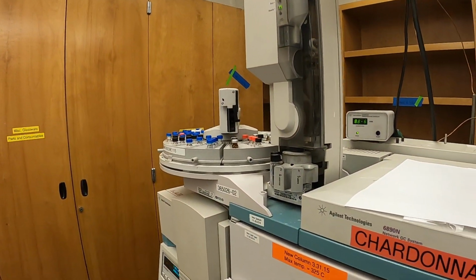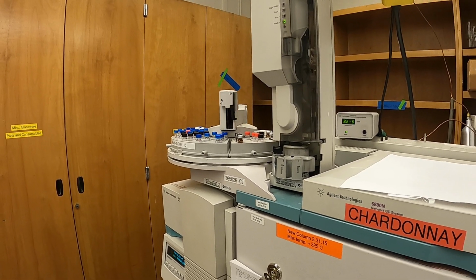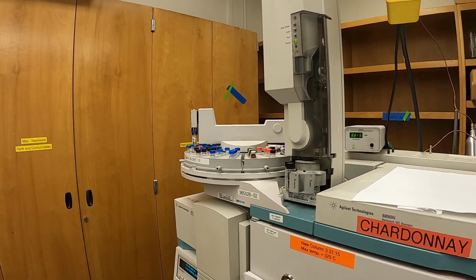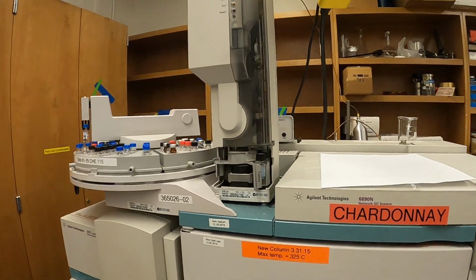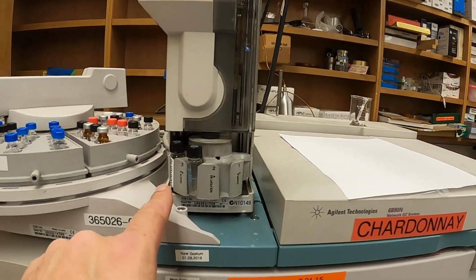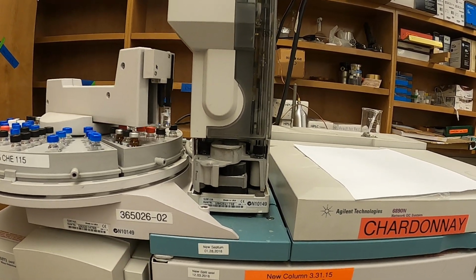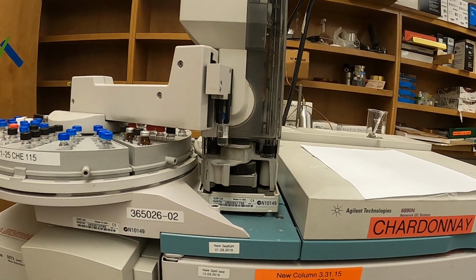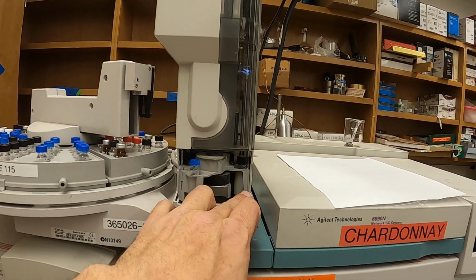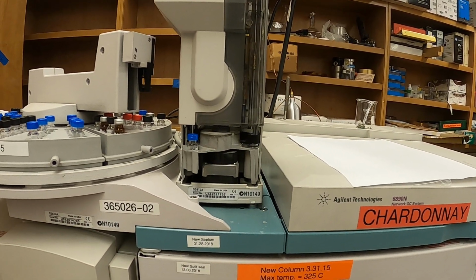We look over to the auto sampler. Now it's starting to move. That's our next indication that automation is running as we expect it to. Okay, I've already filled these solvents. This is the one thing you TAs need to do before the experiment starts, especially if my staff is not here before you. Just to make sure these wash solvent bottles are filled with acetone or hexane. It really doesn't matter.